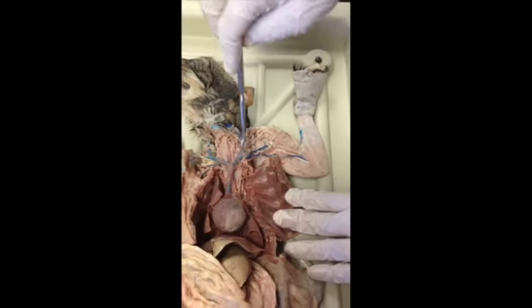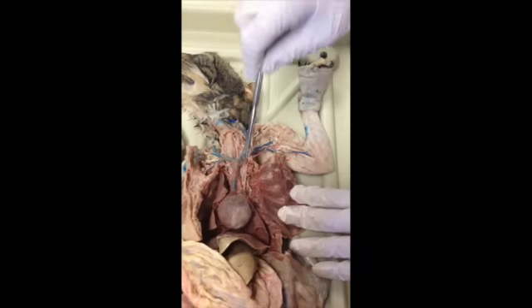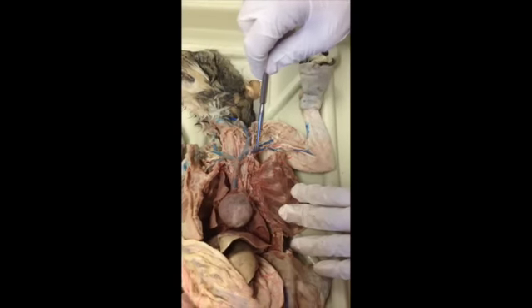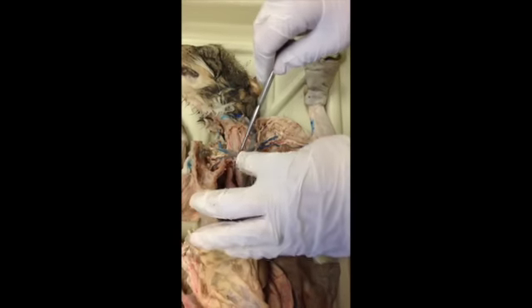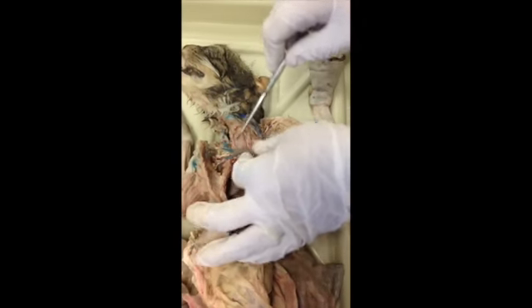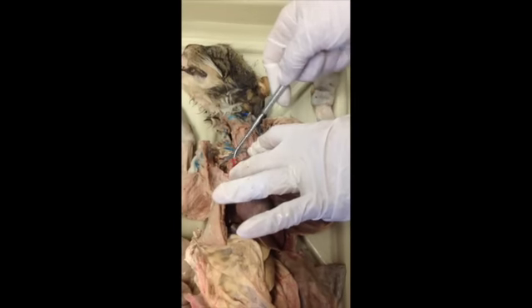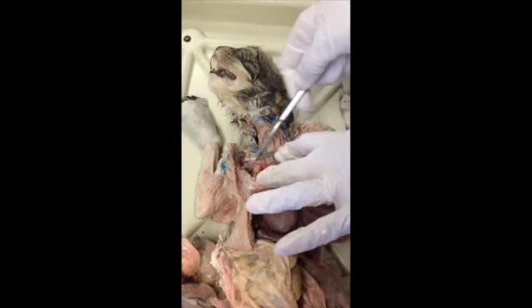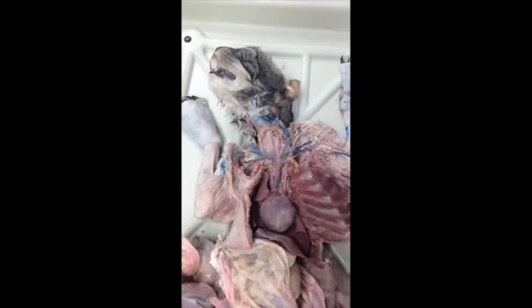Okay. Can you do the artery as well? The artery's different. So we've got subclavian all along this side, and then we've got the brachiocephalic trunk that goes to the left and right common carotids, and then a subclavian for our cat is up farther, and it's kind of hard to see, so he would not look at this cat for that subclavian, because that's too tricky.